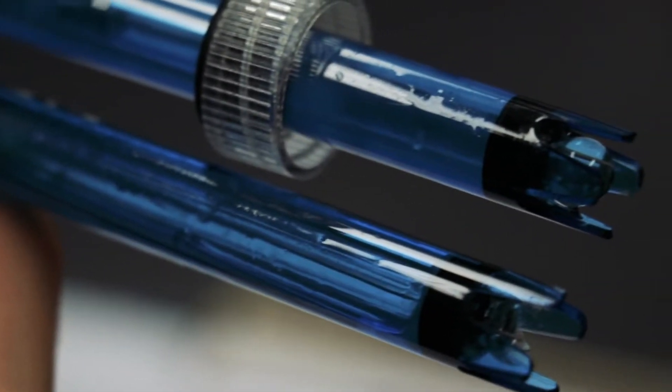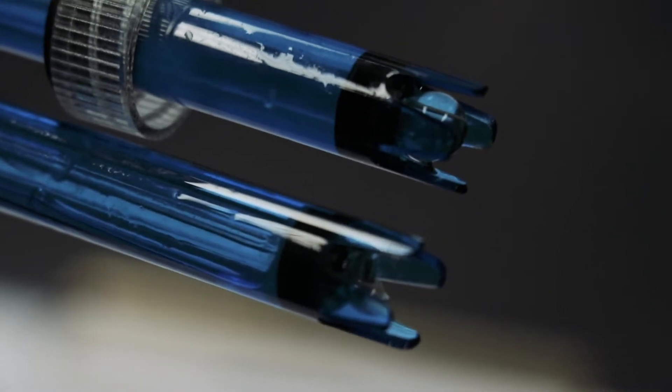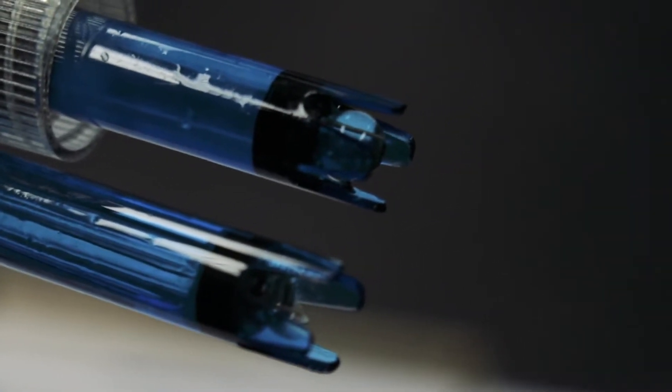Firstly, take special care of the glass bulb and protective prong. The glass bulb is very fragile and the breakage price is $118.